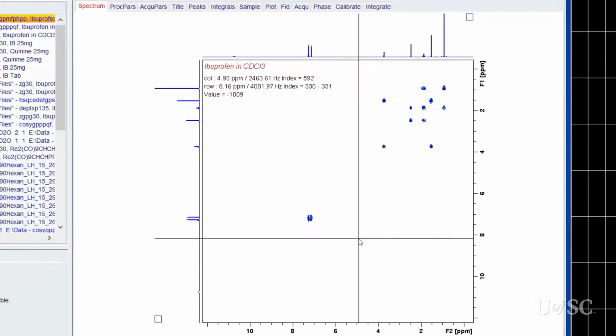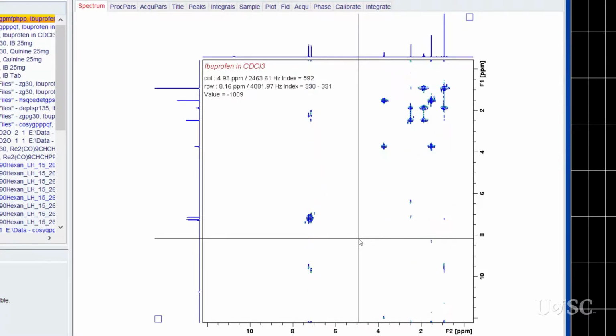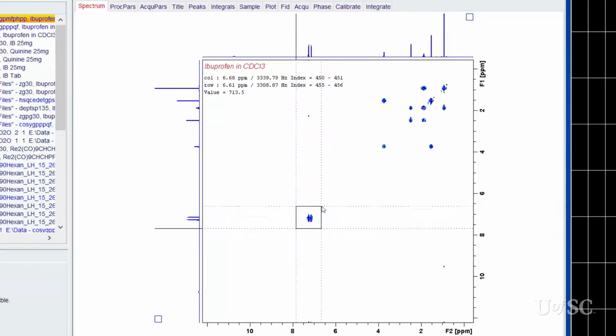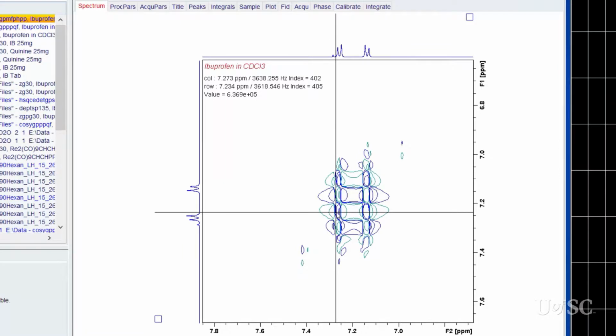The double quantum filtered COSY spectrum of the ibuprofen sample is shown here. The default processing does not include the symmetrization that was performed on the magnitude COSY experiment. There is some T1 noise, but it is low compared to the real peaks. Look at the congested area of the aromatic region. Due to the complex nature of the peaks, there is no clear separation between the diagonal and cross peaks.